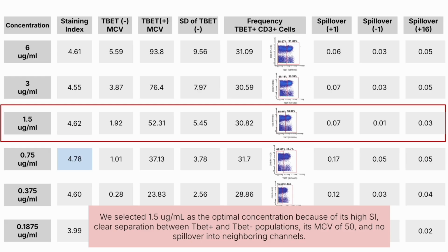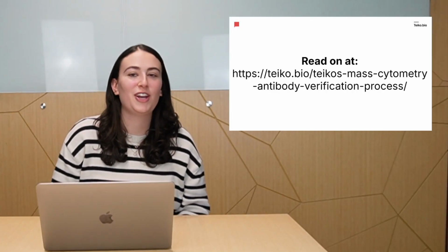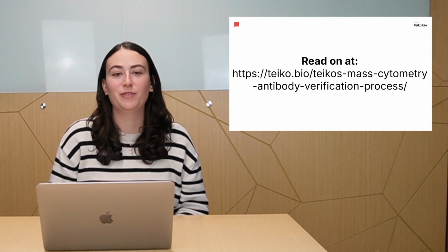Ultimately, we did select 1.5 micrograms per milliliter as the optimal concentration because it has a relatively high staining index. It also has a clear separation between those Tbet positive and Tbet negative populations that we'd be looking at. It has that 52 median channel value, which is what we're aiming for, and it also has very minimal spillover into neighboring channels. So that concludes our video on our antibody concentration verification process.